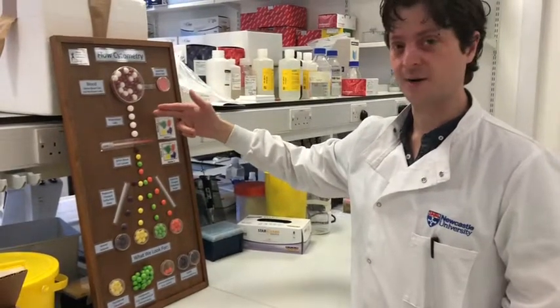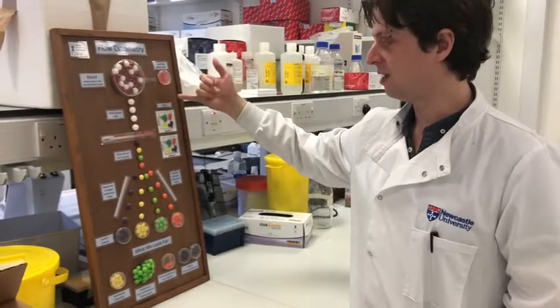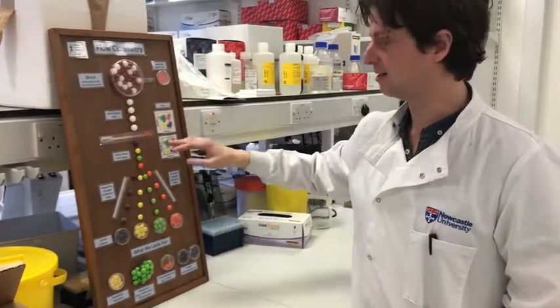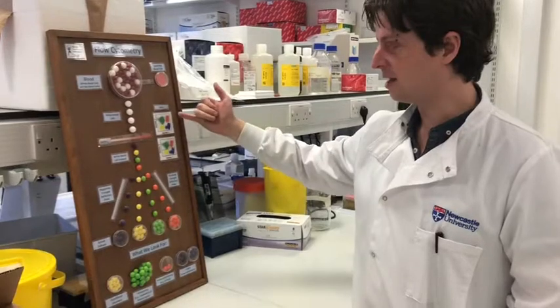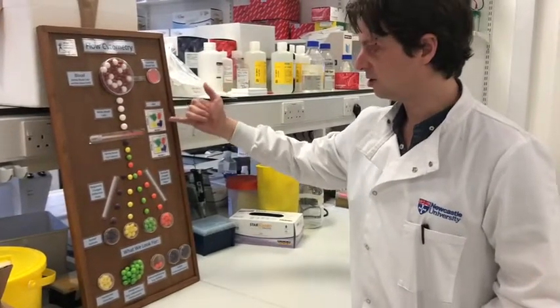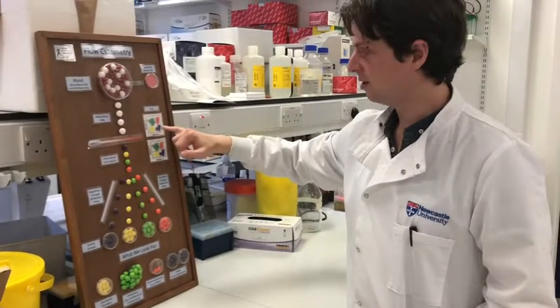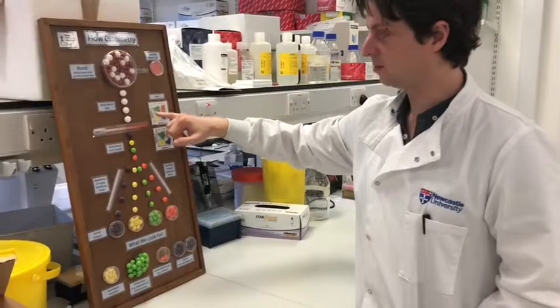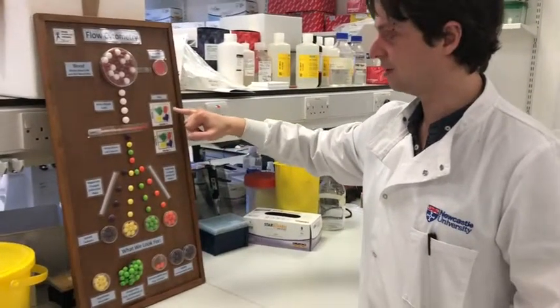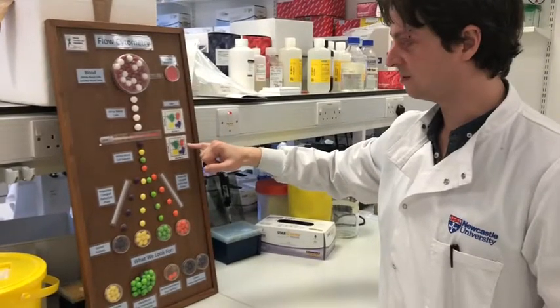We can mark these white blood cells with the different antibody markers that we saw before and pass them through a detection laser. The laser goes past and measures the expression of these markers, and you can see here on the 2D plots. You can then gate the different cells. So, for example, this green cell is positive for marker 2 but negative for marker 1. This orange cell is positive for both markers. You can gate off these cells.